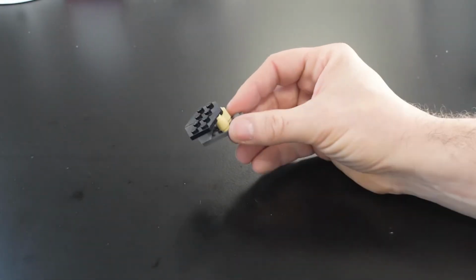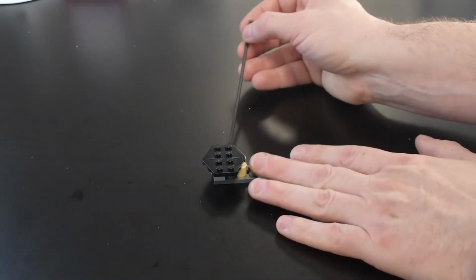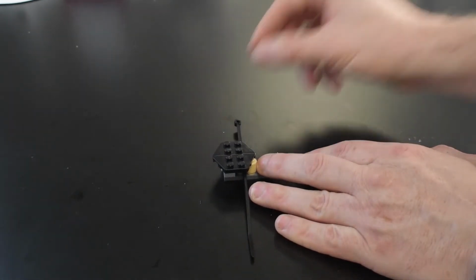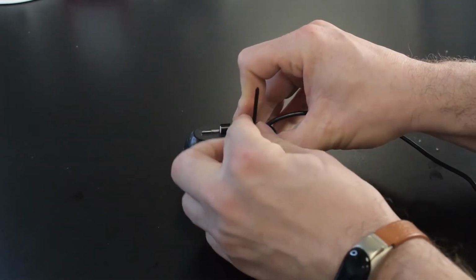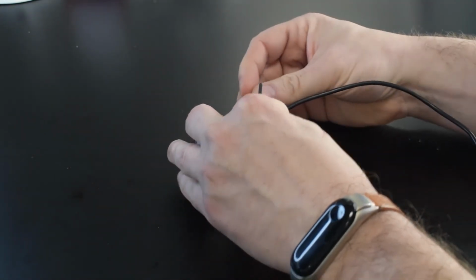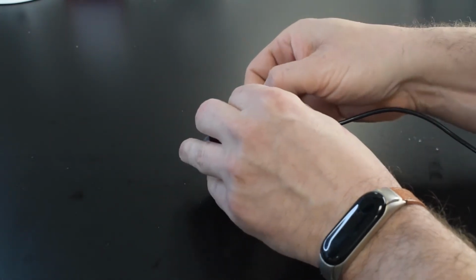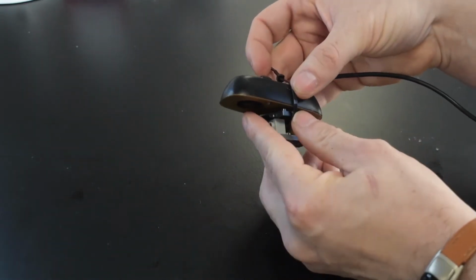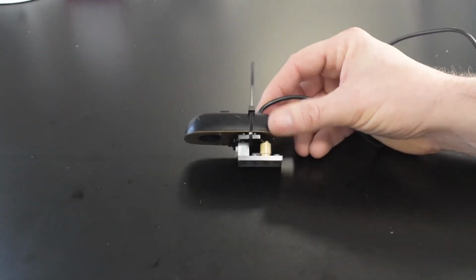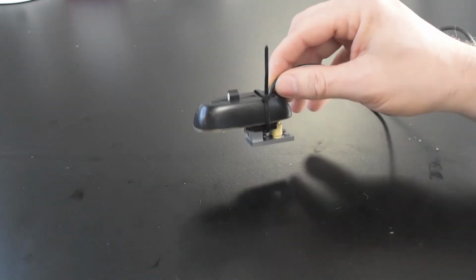Okay, so just a little simple platform. And then we're going to pass through a cable tie here in the gap that we made here. Pop this on top. And this cable tie will just hold everything in place. So there you have it. A nice simple platform to hold your microscope.